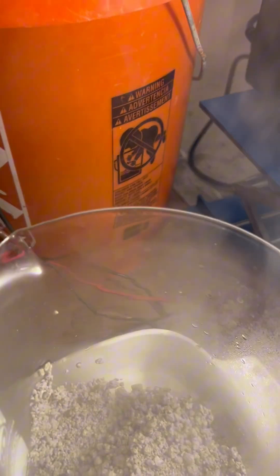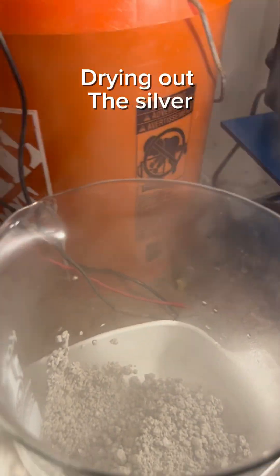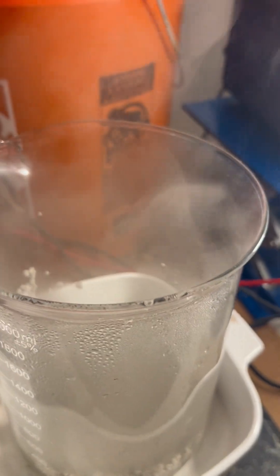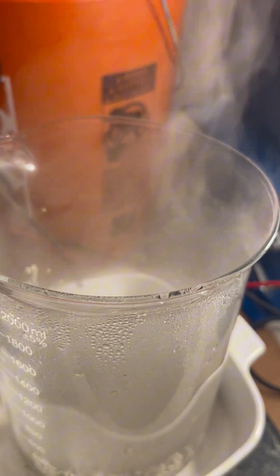We're almost done with this. This is a good amount of silver here. Would I do it again? Absolutely. So stay tuned. We're gonna dry this out and get a weight.